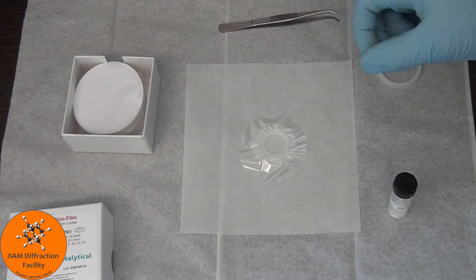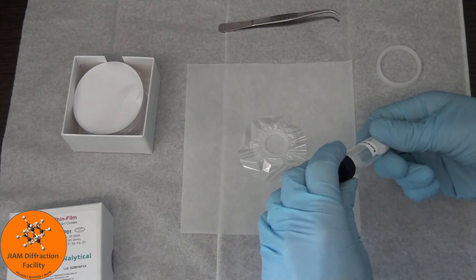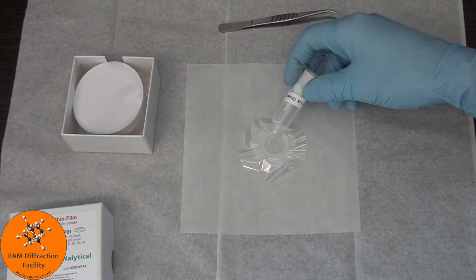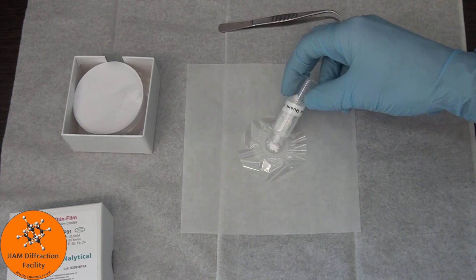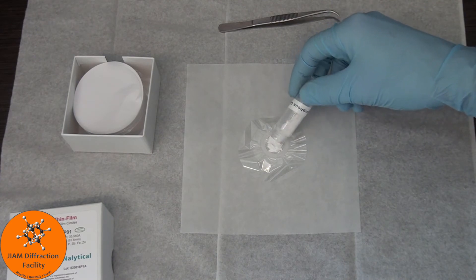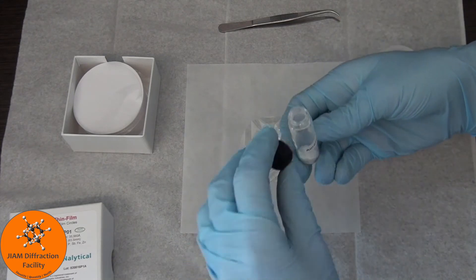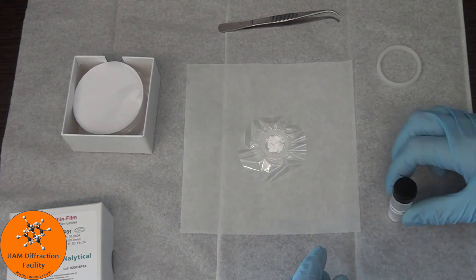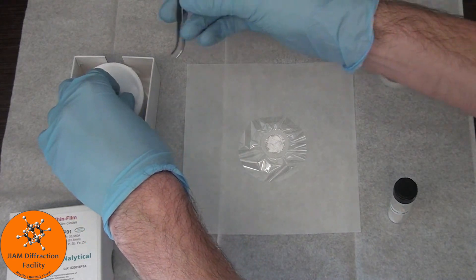This locks that film in place. We can then put our sample inside, and then place another piece of film on top.